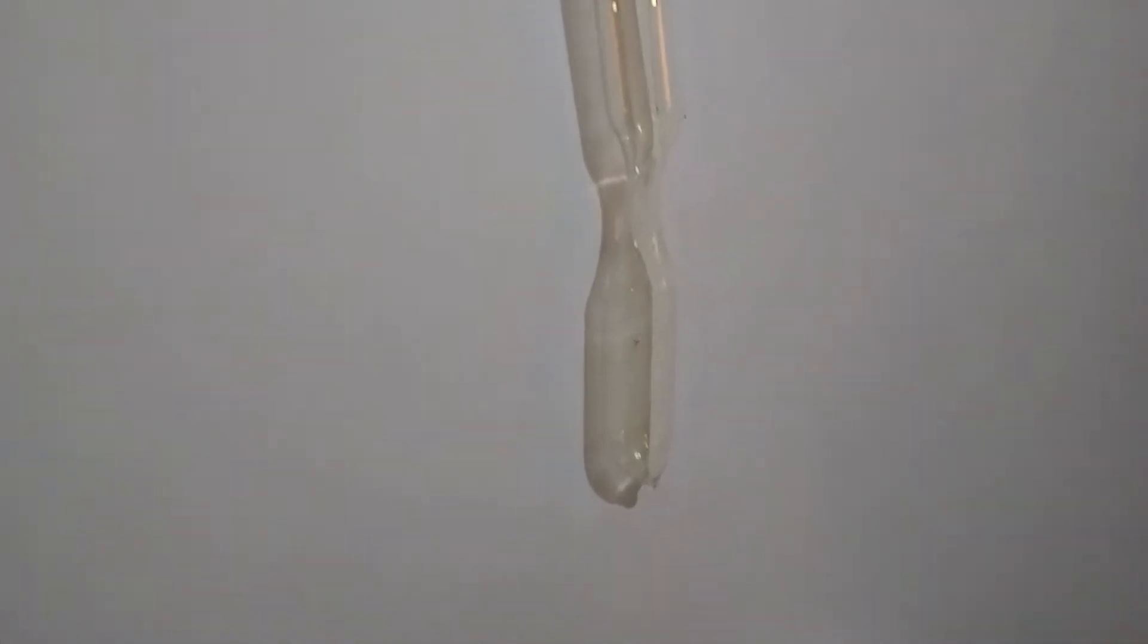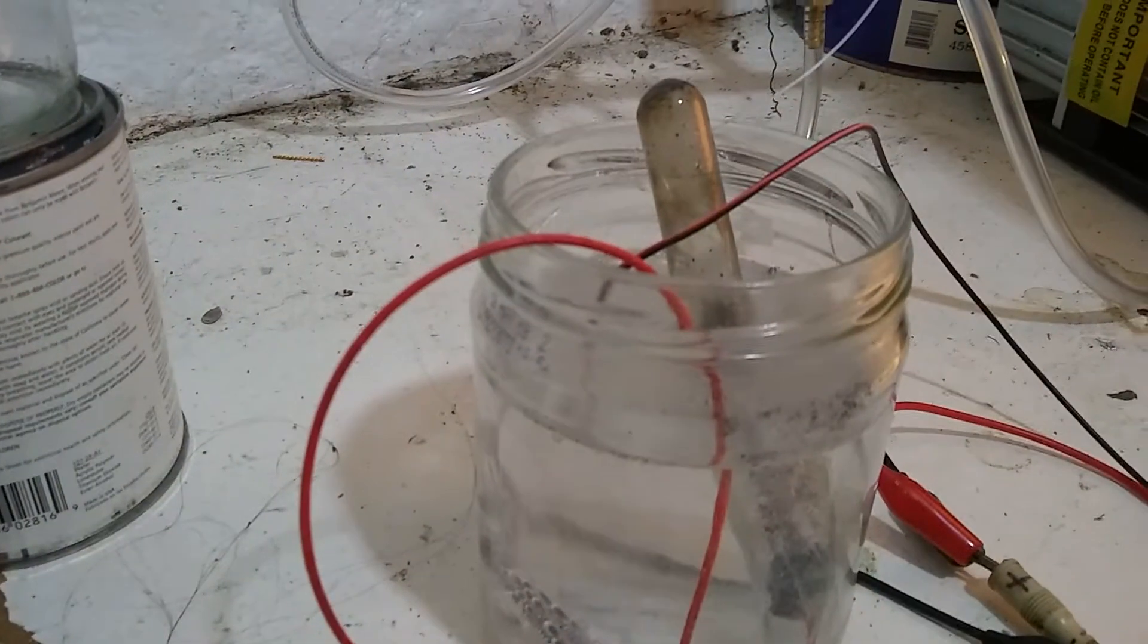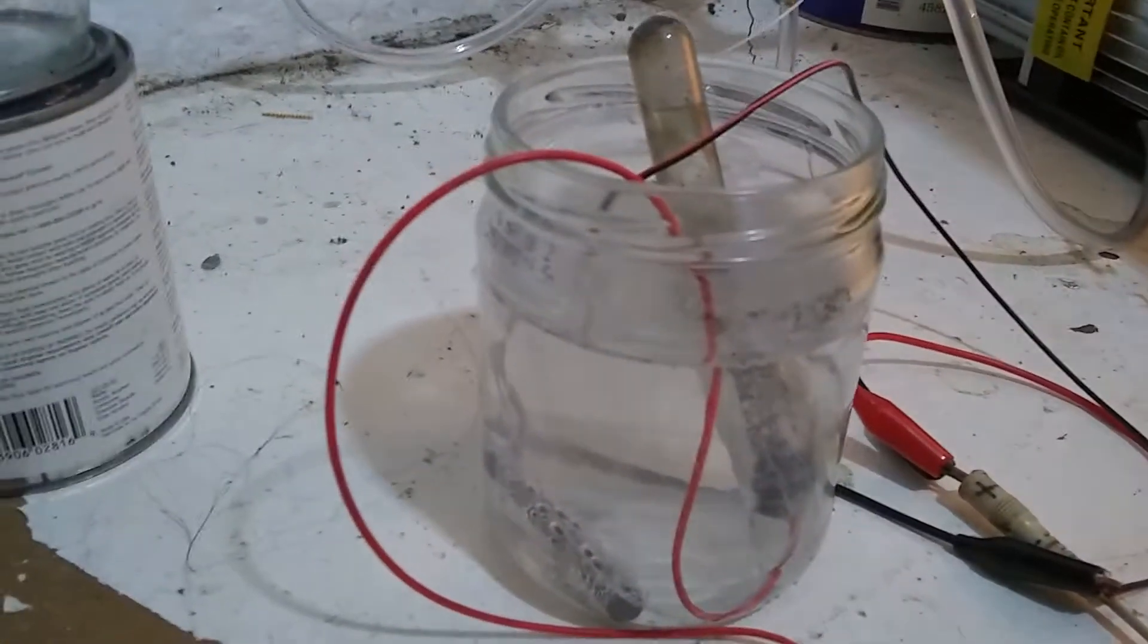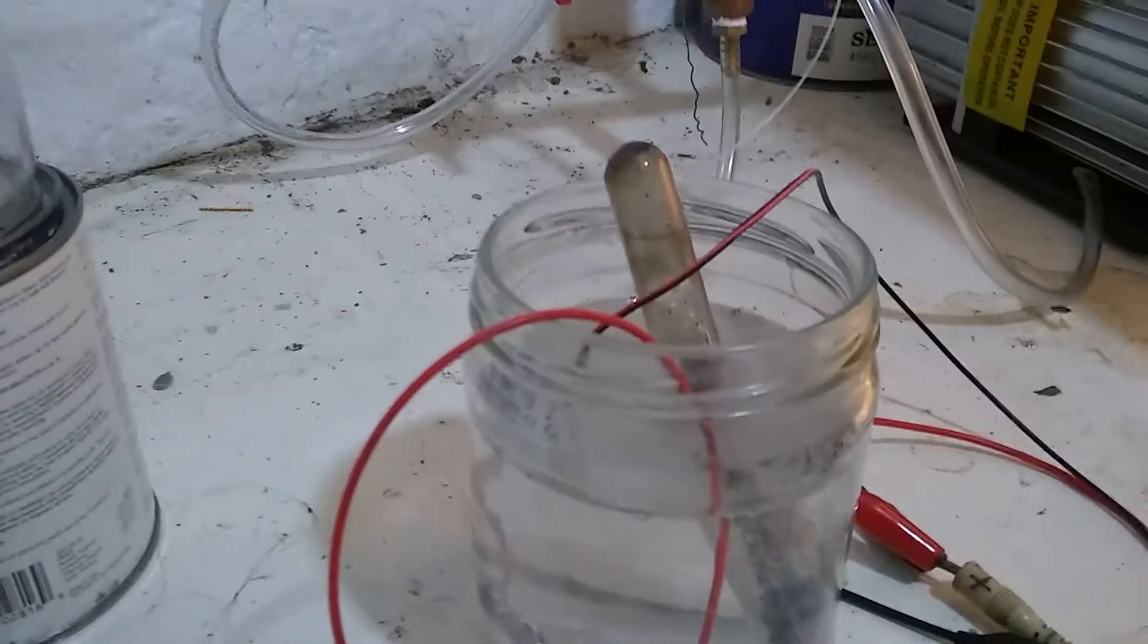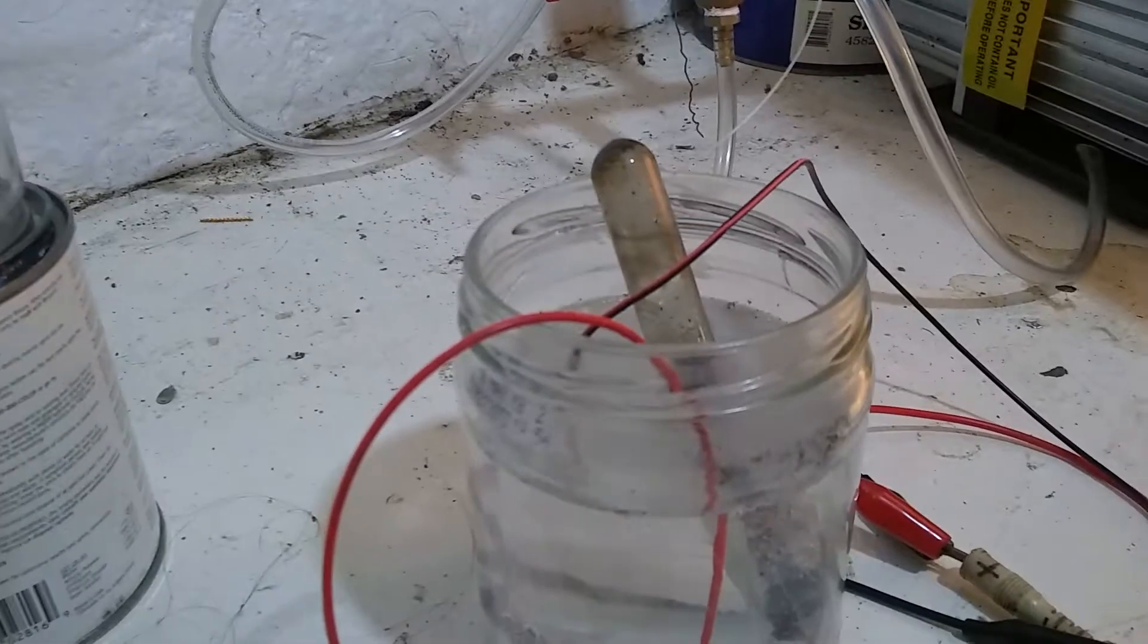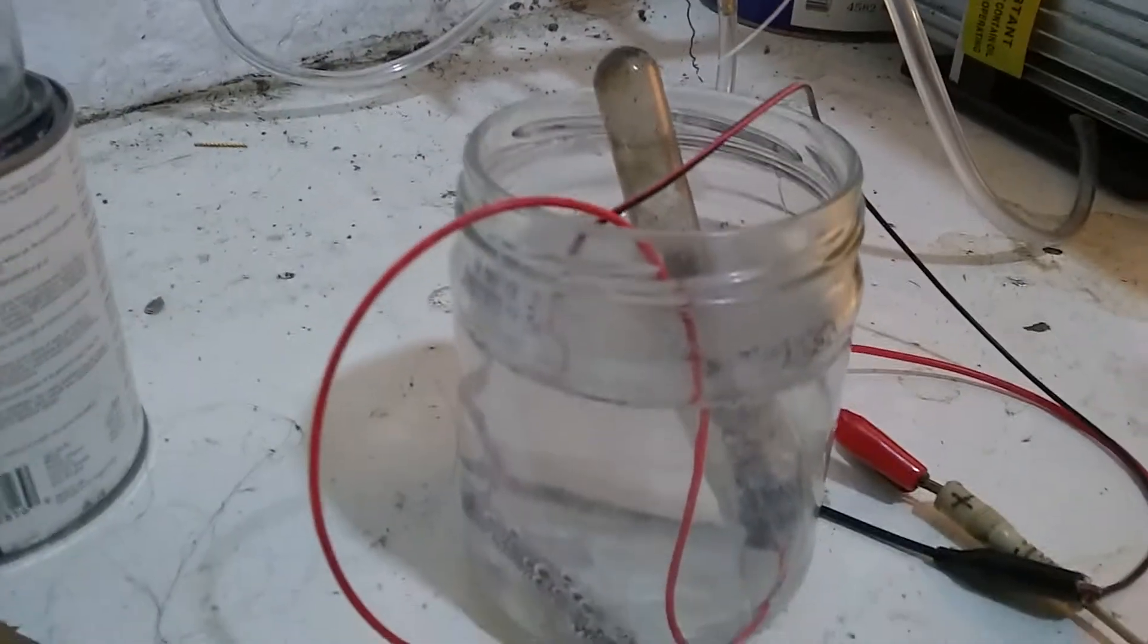A little more than 15 minutes in, and the pale yellow green of chlorine is just starting to show up inside of the ampoule. Now, I'm deliberately doing this process slowly, methodically, carefully, and the reason I chose electrolysis instead of the manganese dioxide method is if something goes wrong, I can just disconnect the power and the reaction stops completely. And I did that for safety reasons.